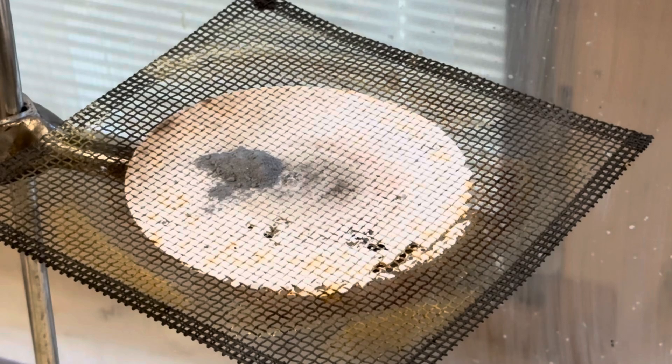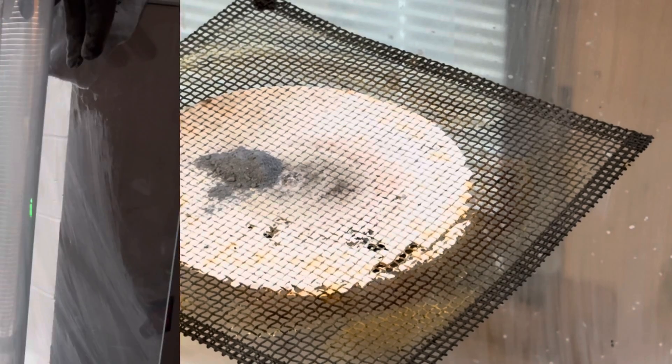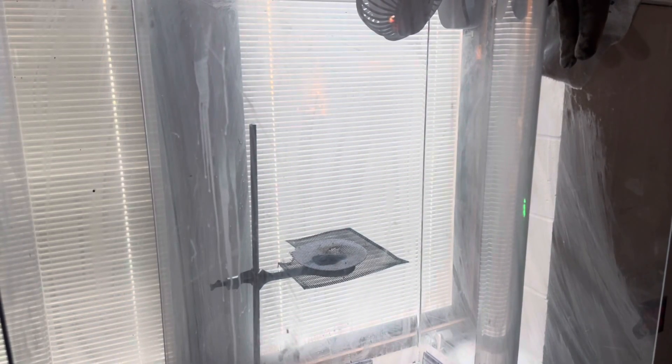Start by measuring out one gram of lithium aluminum hydride. Now you're ready to add a drop of water. Watch what happens.